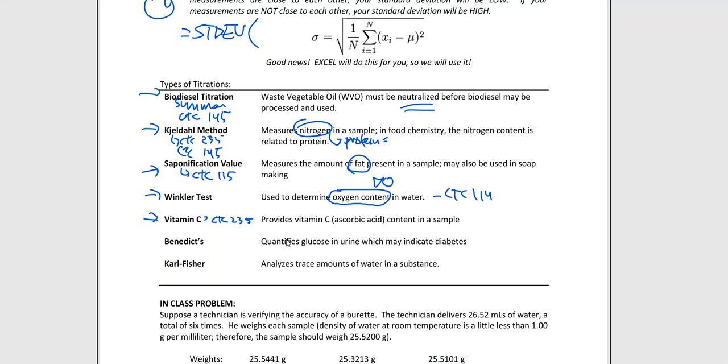Okay, well, we're going to hold them true to that. So is there really 100% of vitamin C in that sample, yes or no? There's a way that we can determine that, and one of the ways, there are many, is through a vitamin C titration. We use an indicator called indophenol, and we titrate, we get these color changes, and we report them, and a burette is used for that as well. So burettes are used for all of these so far.